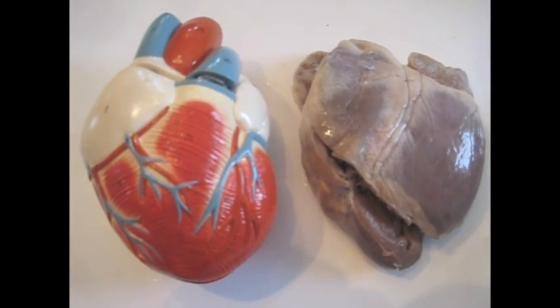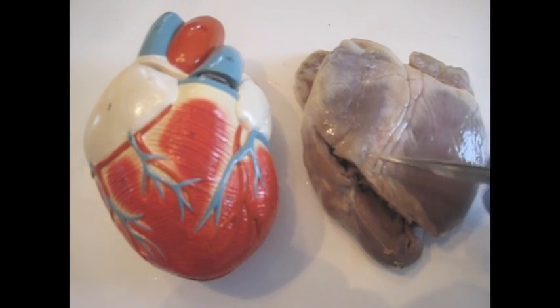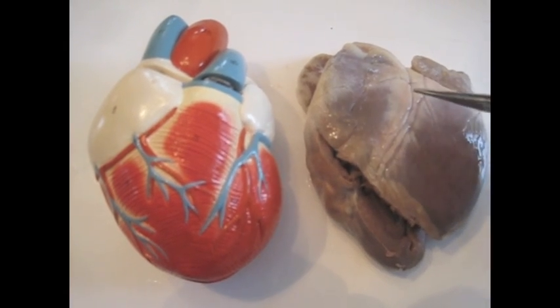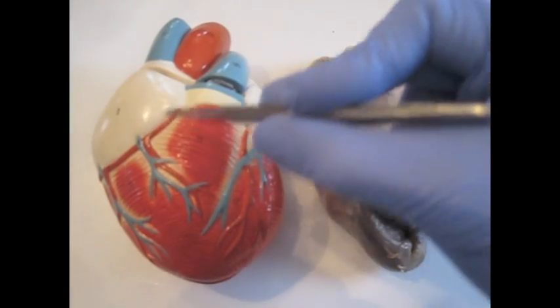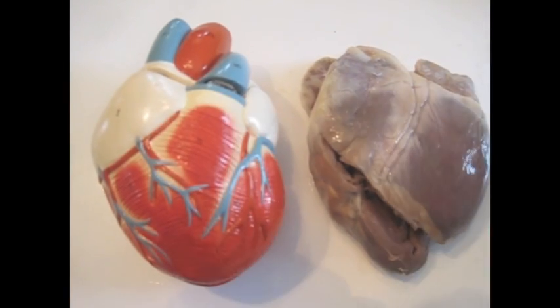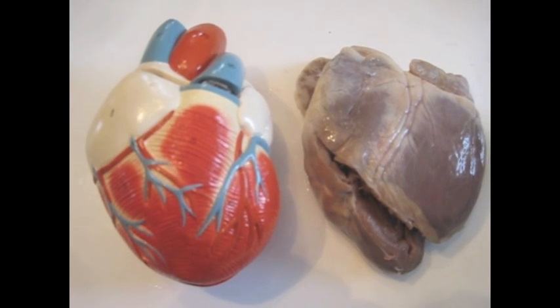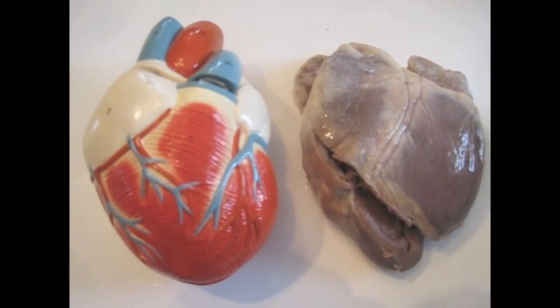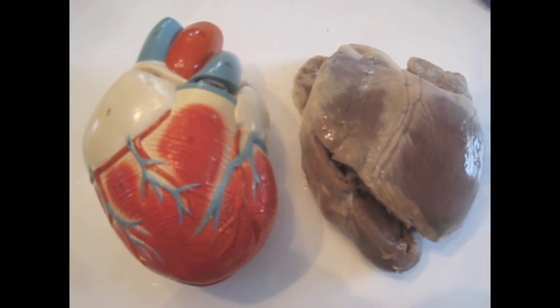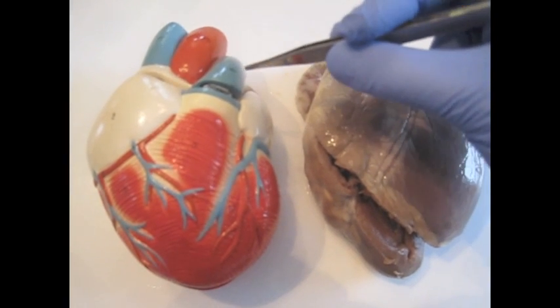We'll be using a sheep's heart for our dissection, shown here on the right, and referring to a model of the human heart. Before getting started, it's necessary to orient yourself and to determine what the left and right, top and bottom of the heart are.